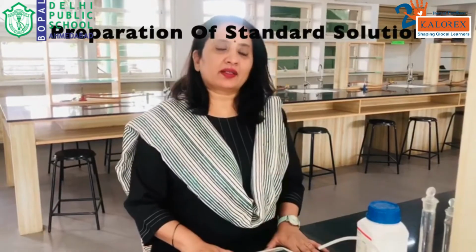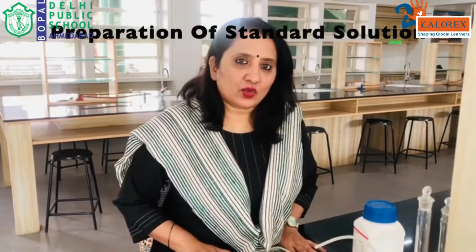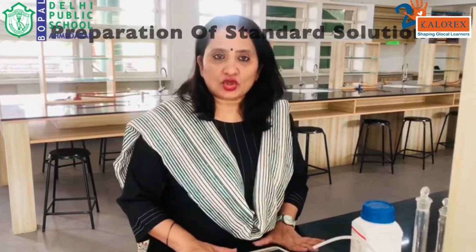But before that we need to learn certain nuances also, and first we'll be preparing the standard solution, after which I'll be explaining what exactly is volumetric analysis. It's also known as quantitative analysis, and we'll go ahead with the practicals. But first, for preparing the standard solution, we need to understand certain terminologies.